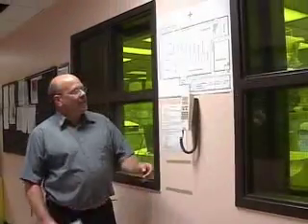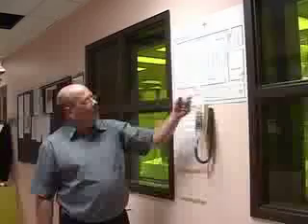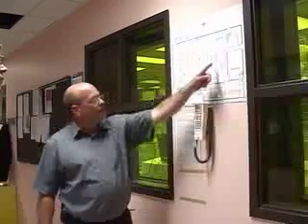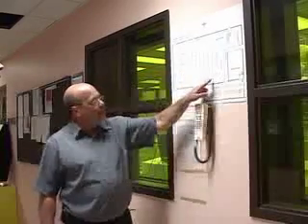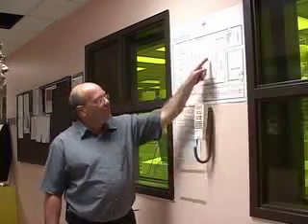So continuing the explanation of the service bay, you can see the layout of the entire clean room, including the service chases and the clean room itself, and all these utilities feeding into these different bays from the service aisle.